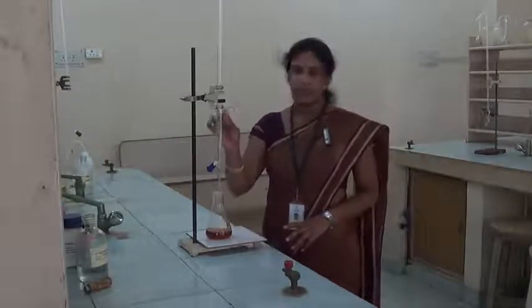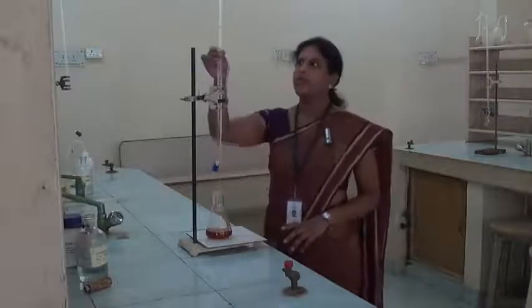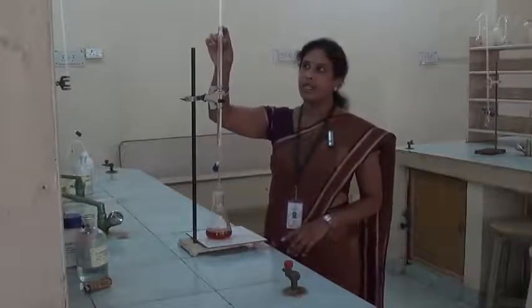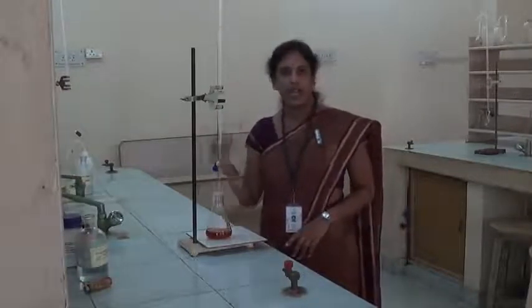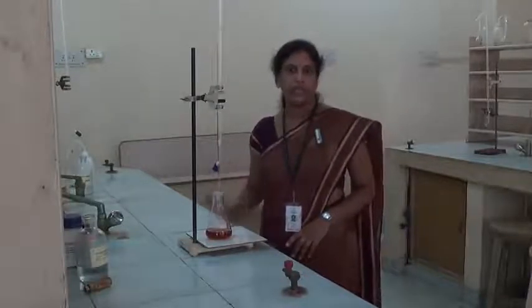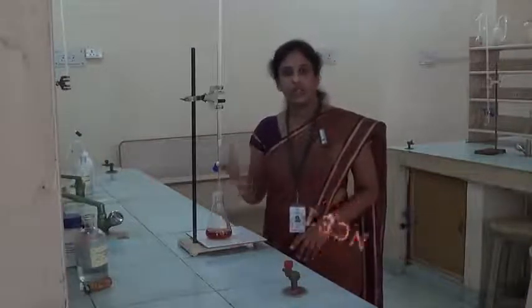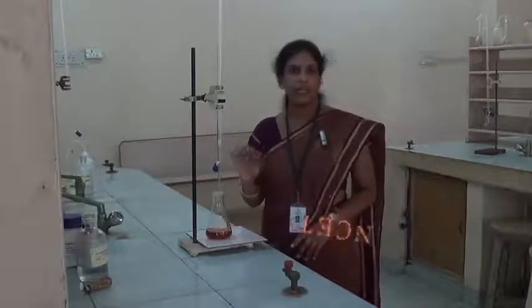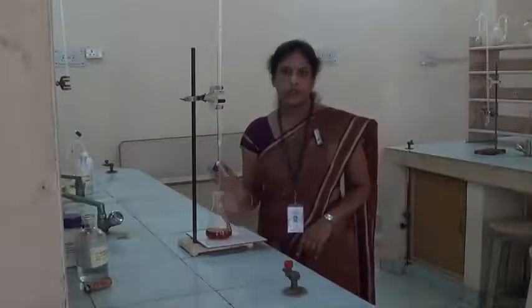Whatever reading we get for the sample titration or back titration, we have to add 10 to it. Example, this is the back titration reading, it is 21.3, and for the blank titration we have to add 10 to this one. That means it will become 31.3. 31.3 is the blank and 21.3 is the back titration. If you take the difference between back and blank, that is V2 minus V1, then we get the amount of dichromate used for the oxidation of waste material present in the wastewater.